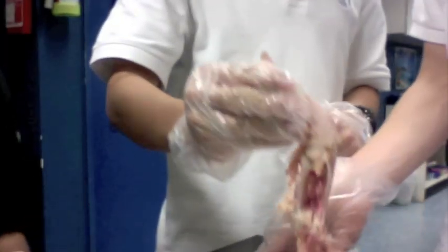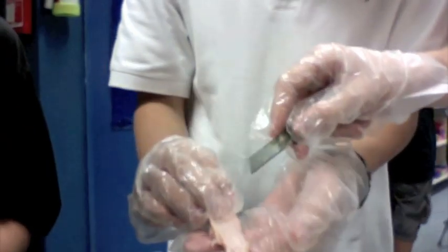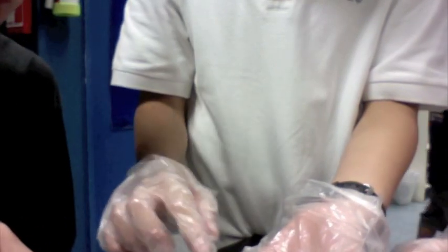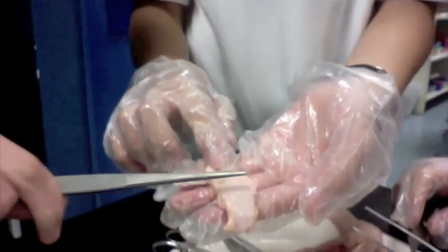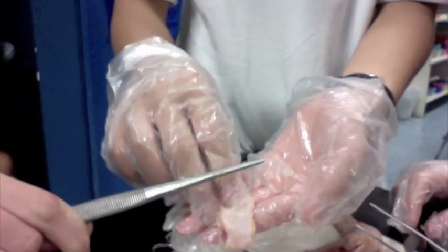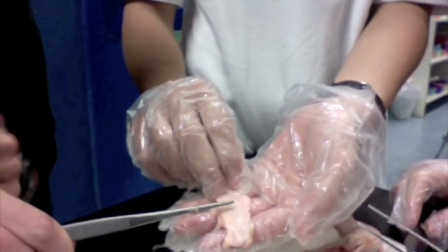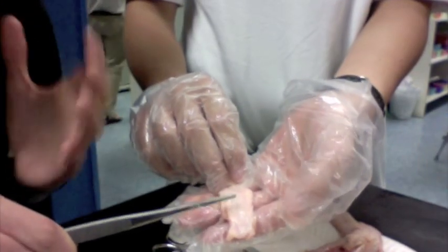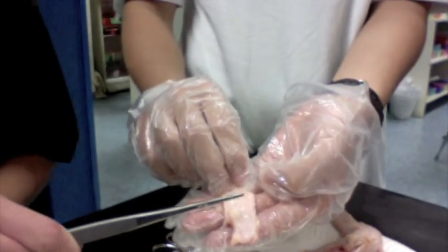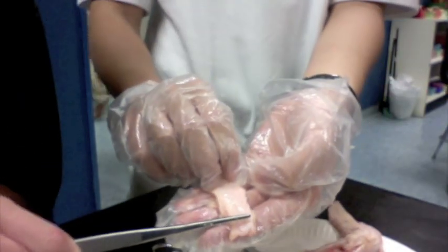We've got the epithelial tissue right here. The epithelial tissue is basically the barrier between the inside of the chicken and the outside of the chicken.